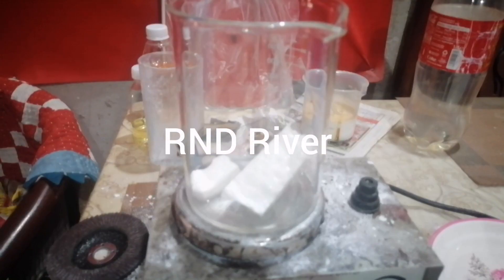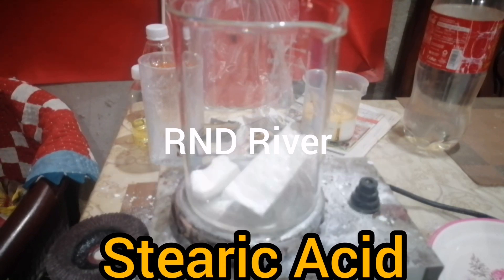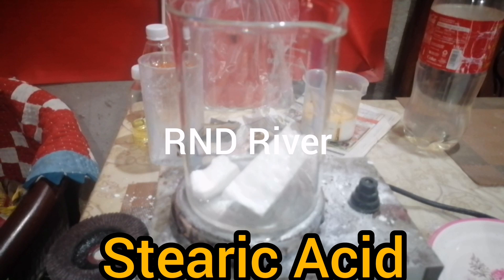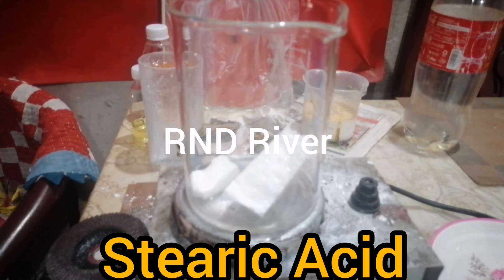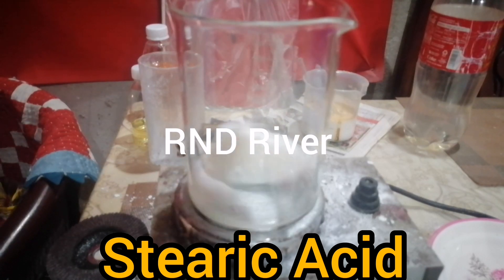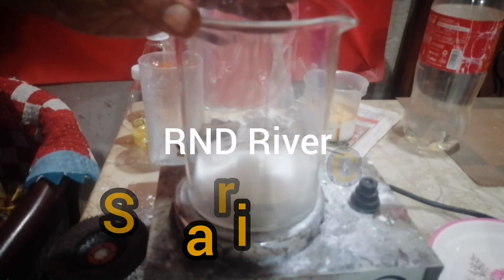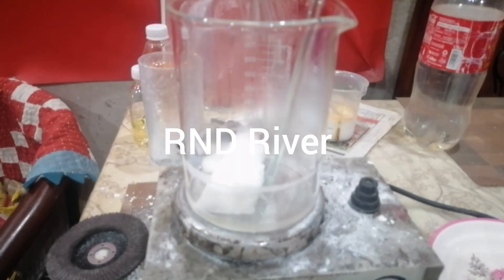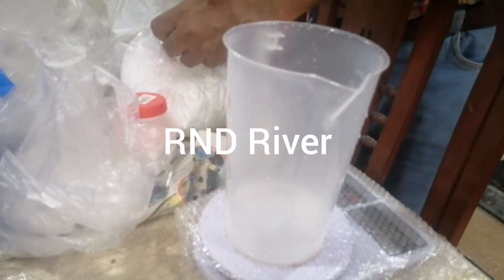First of all you have to take stearic acid. As you take stearic acid in your vessel, beaker, or machine, raise the temperature between 60 degrees centigrade to 70 degrees centigrade. Do not stop the heat until the process is complete.